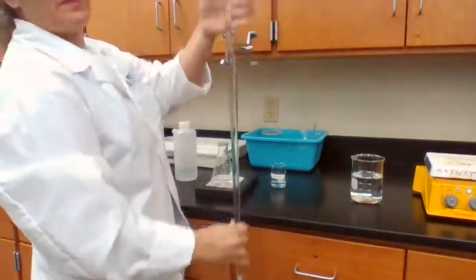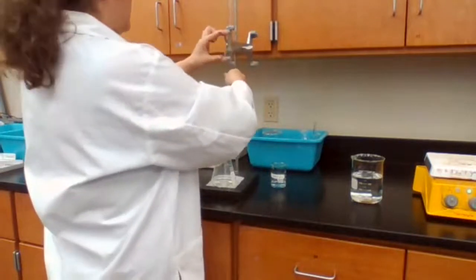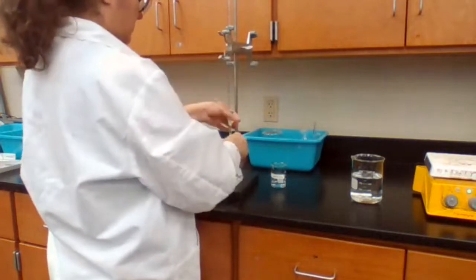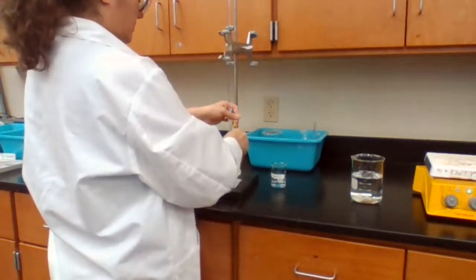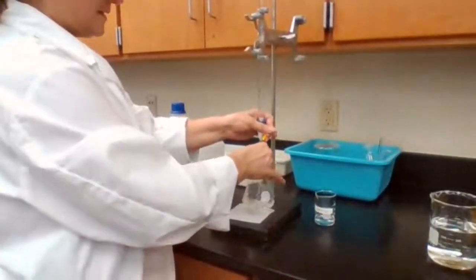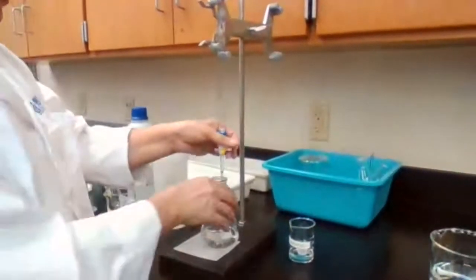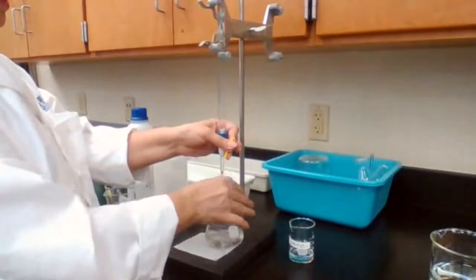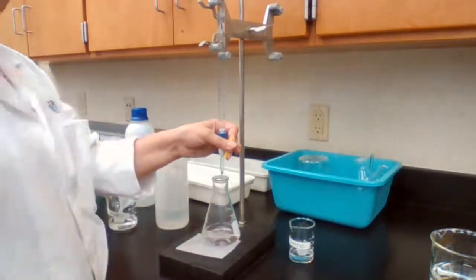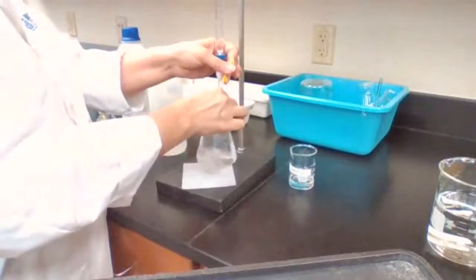Okay. Just want to make sure the meniscus is exactly at 0. At the beginning, I can add sodium hydroxide fast. I'm bringing the camera closer, so hopefully you see the color. The pink color appears in the center, and it disappears. See the pink color? It appears and then disappears when I mix it.